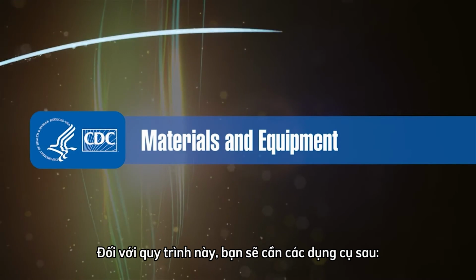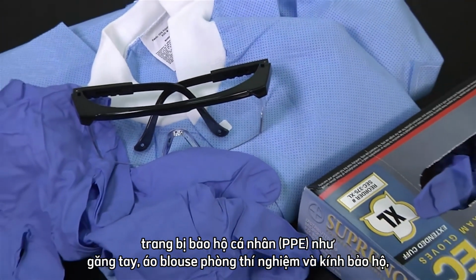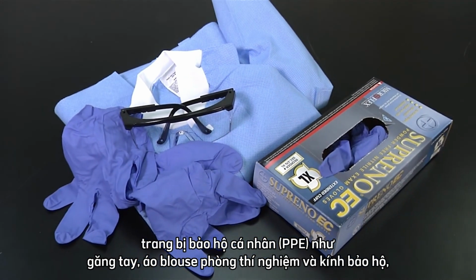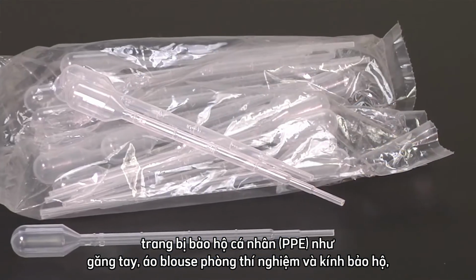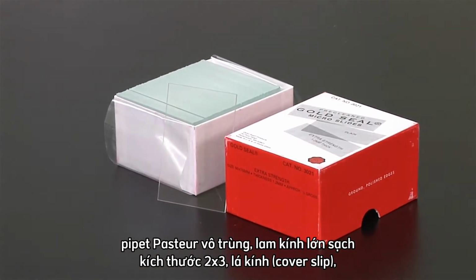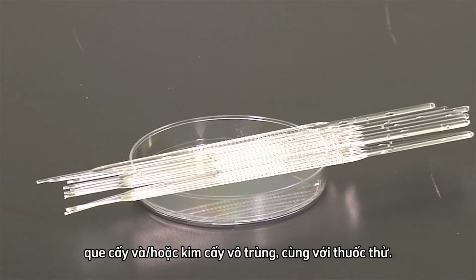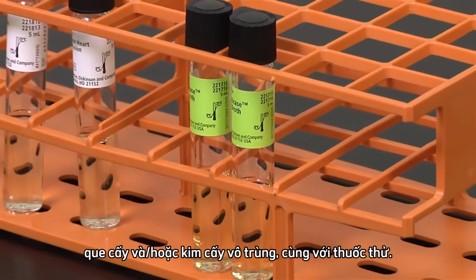For this procedure, you will need the following: personal protective equipment, PPE, such as gloves, laboratory coat and safety glasses, sterile Pasteur pipettes, clean large 2x3 glass slides, a cover slip, sterile loops and/or needles, and your reagent.